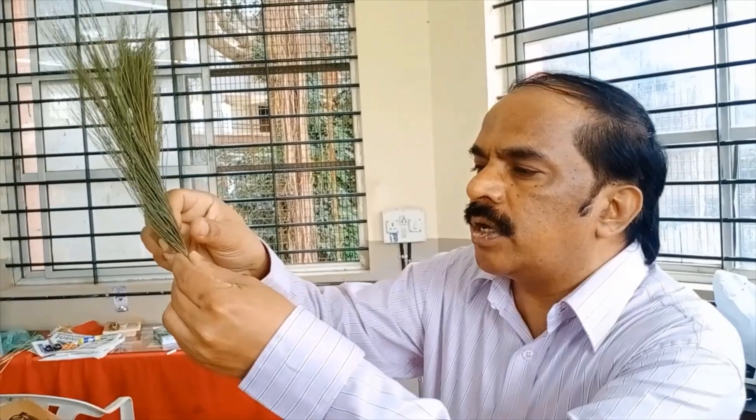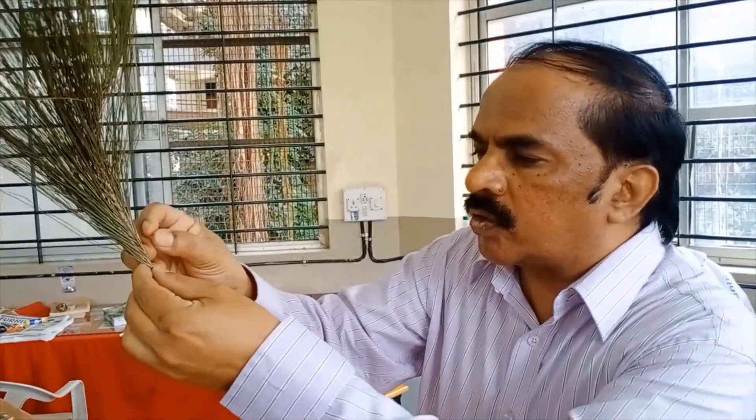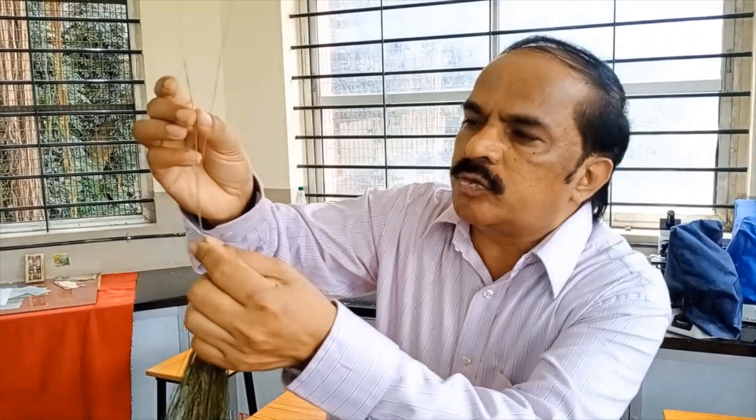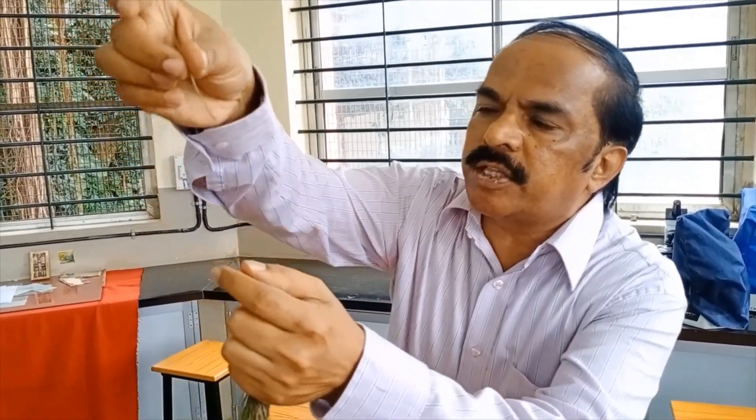The first gymnosperm is Pinus, called the pine plant. It is usually growing in temperate conditions in alpine regions. The plant is an evergreen cone-shaped tree which has got long shoots and dwarf shoots. What you are seeing here are the dwarf shoots, also called spurs. I will just take out one spur — this is a spur, a foliage spur we call it, and the spur will have the needles.